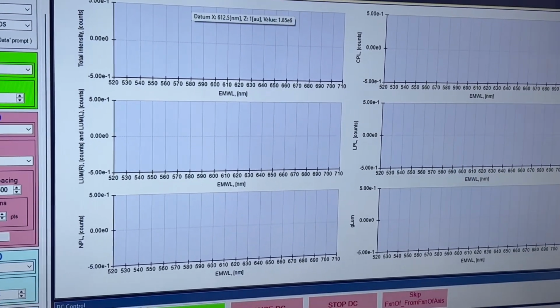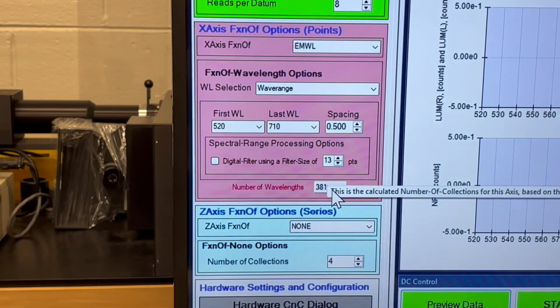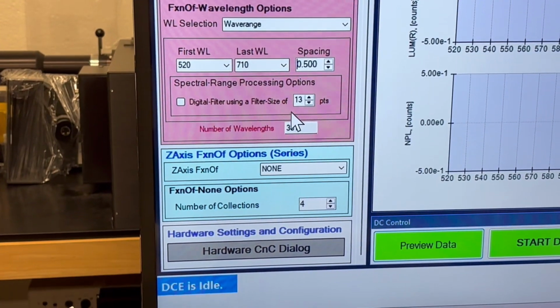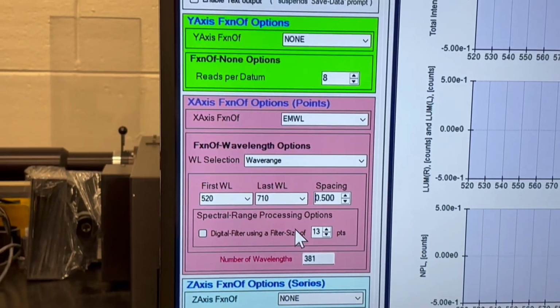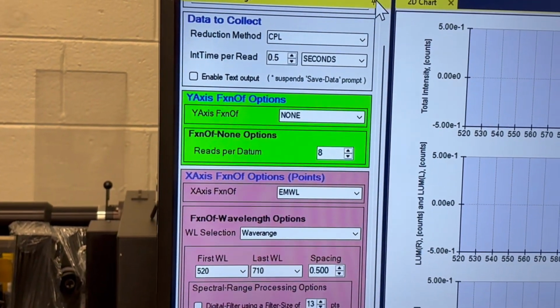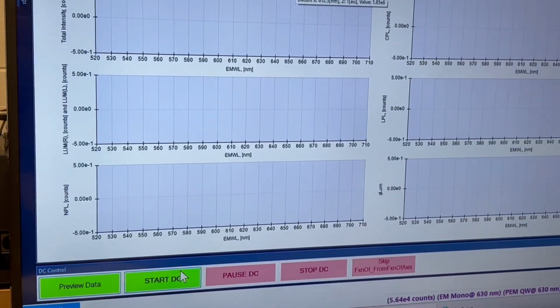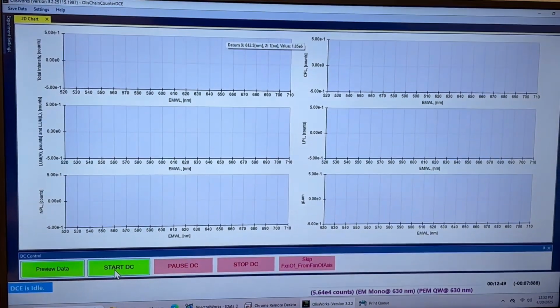So the things will change as they have on the screen to our right, all of the charts. It computes for me and says you've got 381 data points, and if I was going to do 4 collections, that would do that 4 times. Good. Now, having done that, if I choose, I can get rid of the charts, and I end up with the full screen for data and so forth.